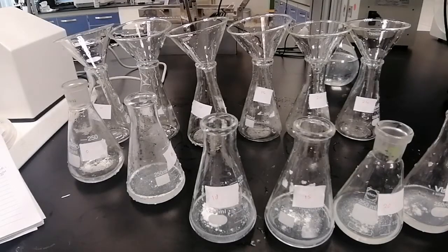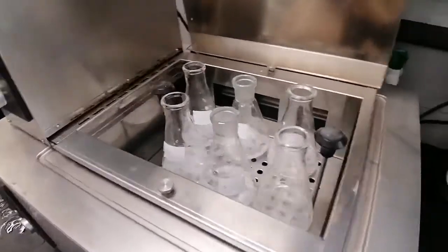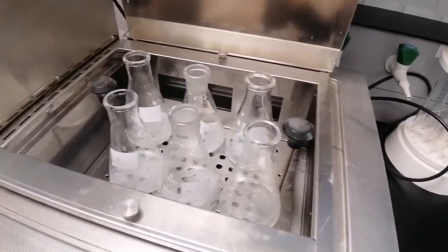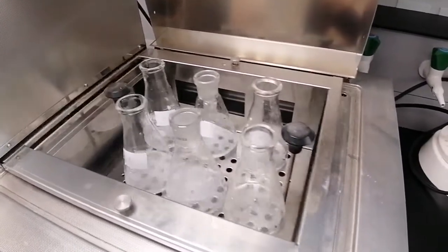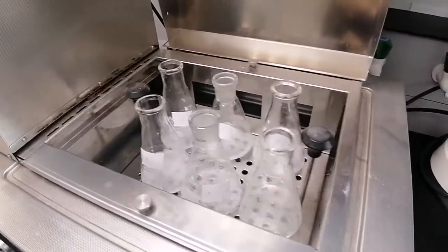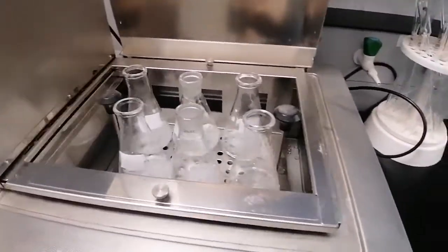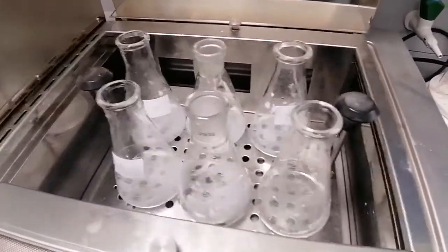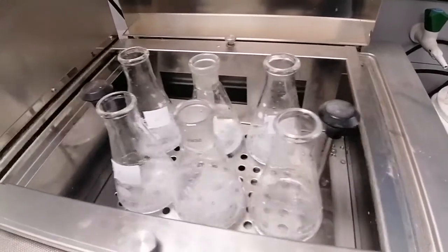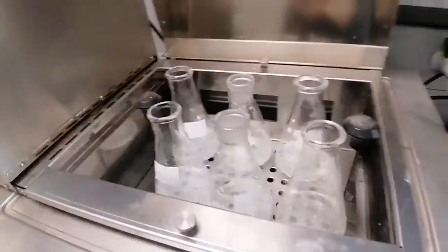We use 1 ml of the filtrate, filling up to 100 ml of the sodium hydroxide solution. Okay, and now we have started the shaking of these flasks. We will shake for almost 15 minutes. We won't prepare any calibration solutions here, as we will use the absorptivity measured at the same lambda in the previous part. We will shake for 15 minutes, and then we will filter these solutions, taking 1 ml of the filtrate and filling the volume up to 100 ml with sodium hydroxide.